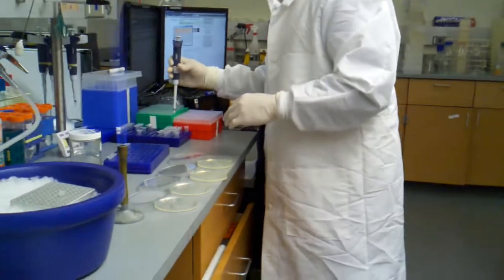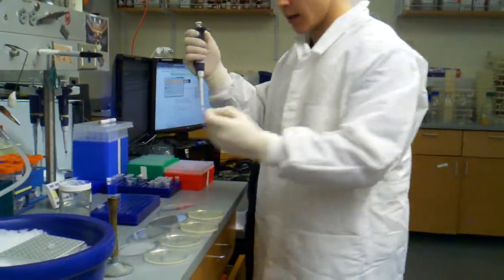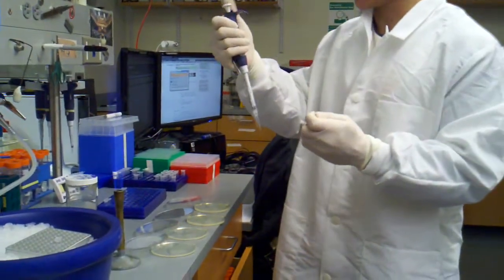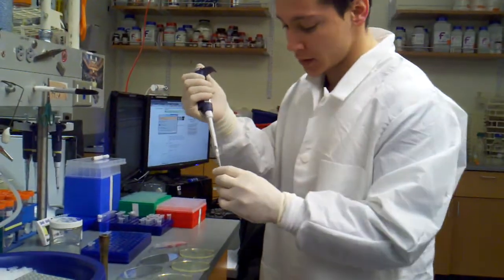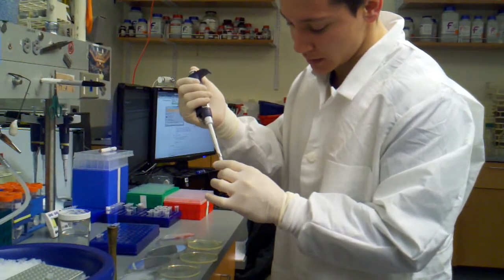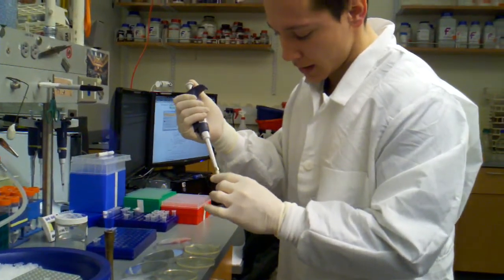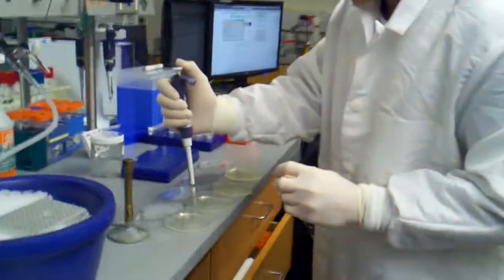Let's grab my pipette. I have about 150 microliters, so I can set to 150 microliters. We're going to resuspend it, and 33K goes on 33K.